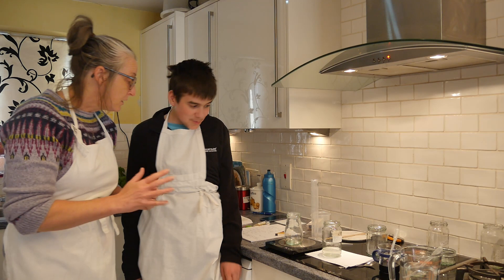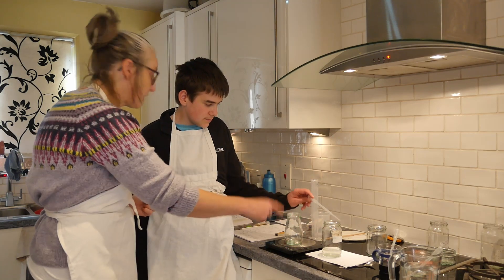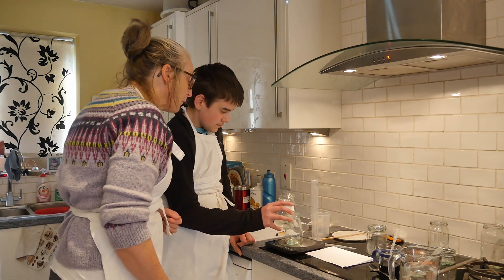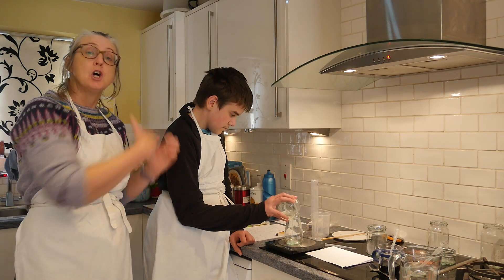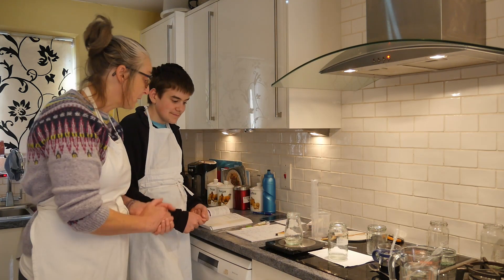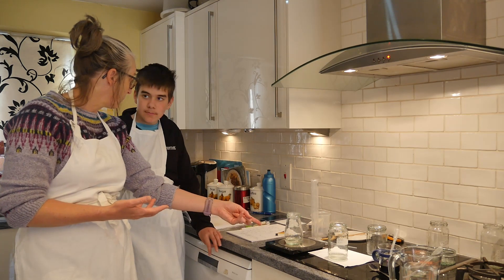We're going to take 25 millilitres out of that jar — half of it — because we're just testing it for pH so we don't need very much. We're going to add in another 25 millilitres of water, taking it down to half the concentration it currently is. So if we've got a one molar concentration and we dilute it to half, what molarity have we got now?